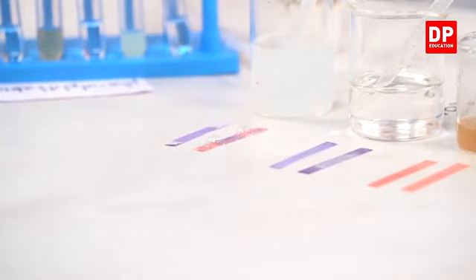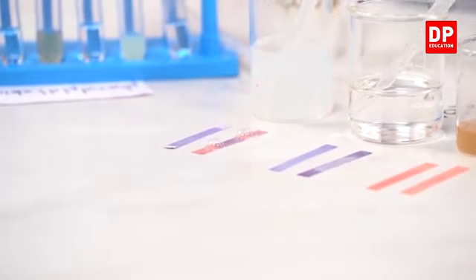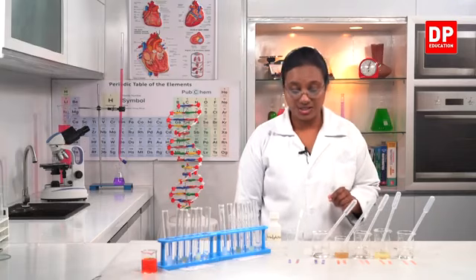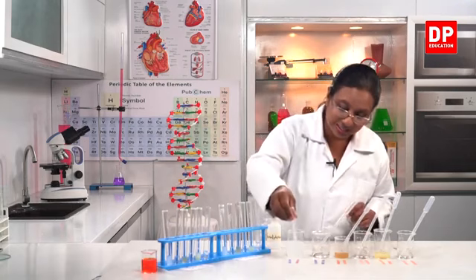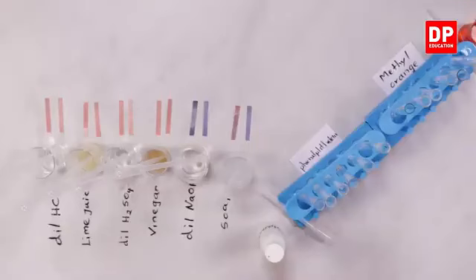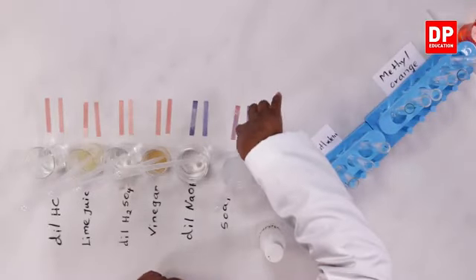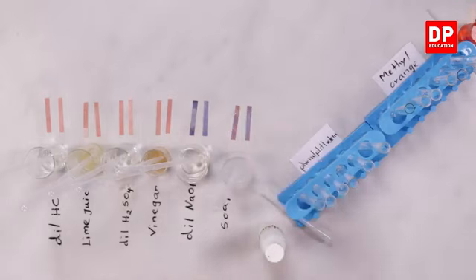So here you can see. Now sodium hydroxide is a strong base. So immediately, if you have been observing closely, immediately the color change. But with the soap solution, you can see it's taking a little longer time. But still, you can see the color change. Only where the air bubbles are, there's no change. But where the soap solution is, you can see that the red litmus has become blue in color.